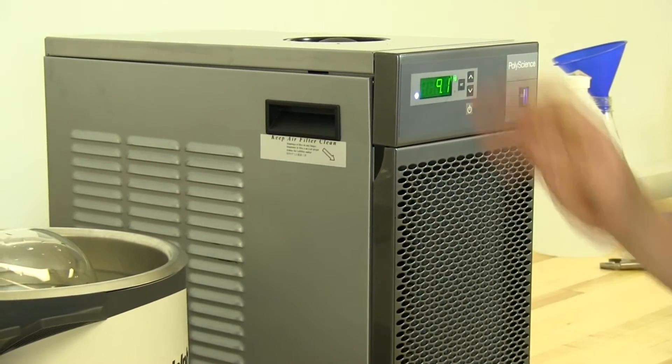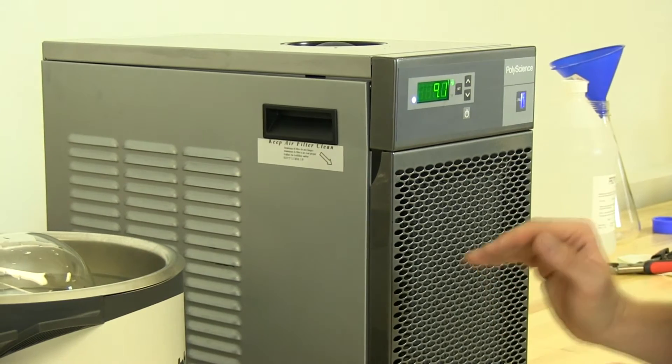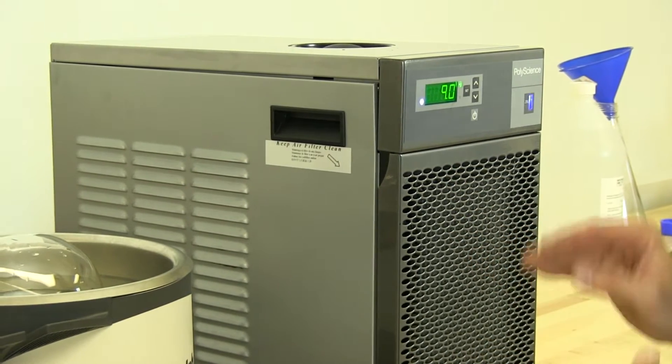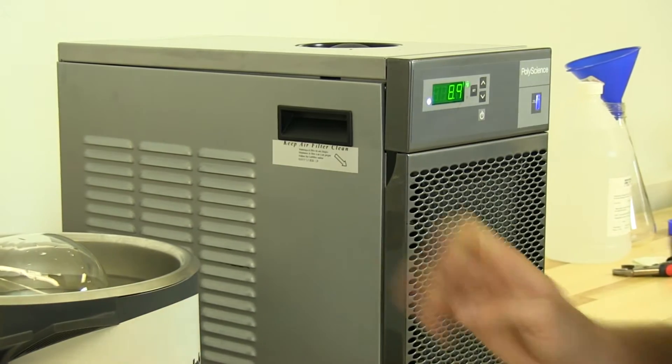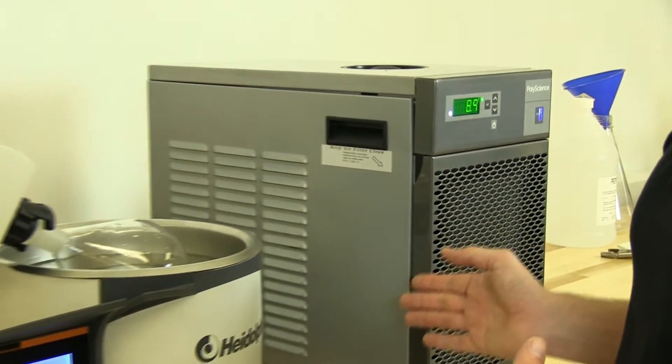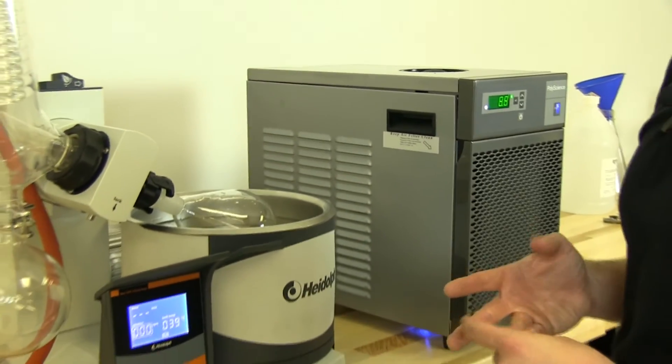Still at 9.1°C, but the glycol will allow this to move a lot faster than just water. We wouldn't even be able to hit the negative temperatures if we did not have the glycol mix.